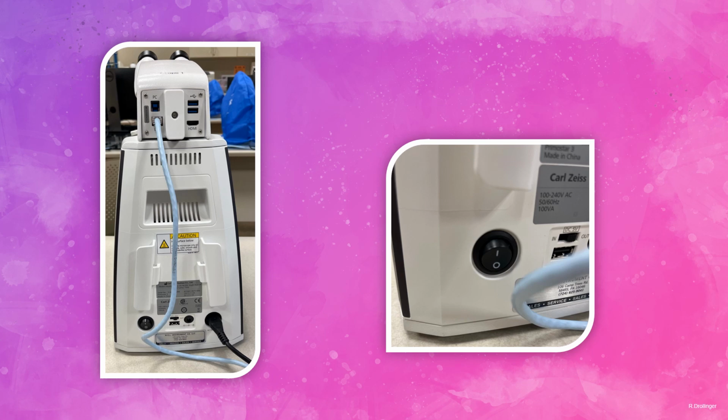I've enlarged a photo of what this power switch looks like on the right-hand side of this slide. When the microscope is not in use, it must be powered off. And let me just use a pointer here so we don't get confused. That cord there is the cord that connects the scope to the network. If you're using just a regular compound light microscope that doesn't have digital classroom capabilities, that cord doesn't exist.